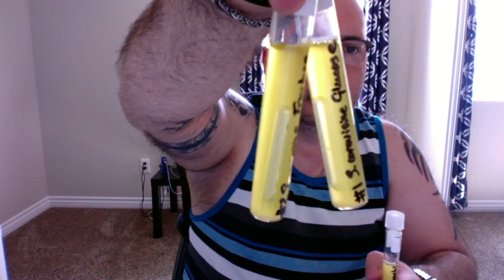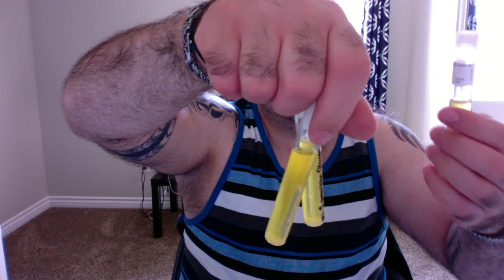So fructose, glucose, and mannitol are all yellow. It's safe to conclude that S. cerevisiae definitely is a fermenter, and these two organisms for sure. And these two organisms, which are glucose and fructose, there's definitely some foam here. And in the mannitol one, there's also a little tiny bit. So S. cerevisiae itself is a fermenter.